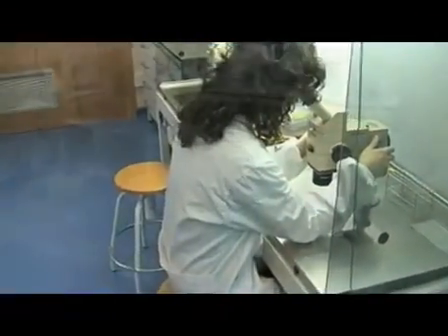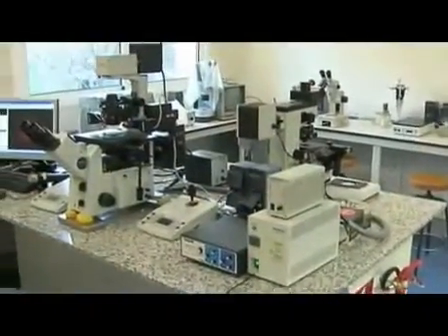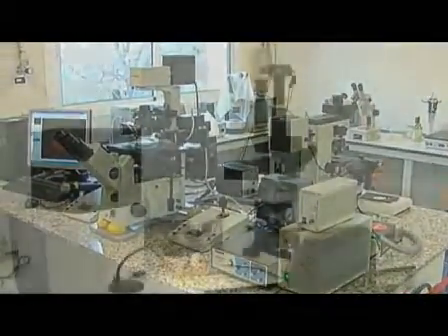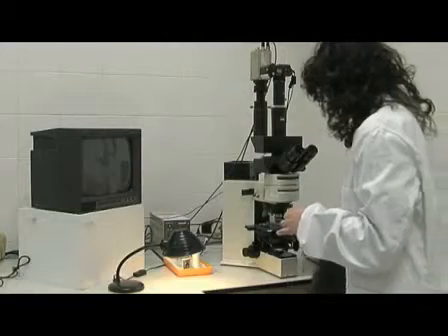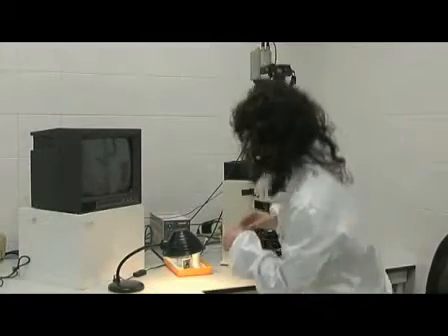Today we are going to illustrate the fluorescence in-situ hybridization protocol in decondensed sperm nuclei for the analysis of chromosomes 13, 18, 21, X and Y.